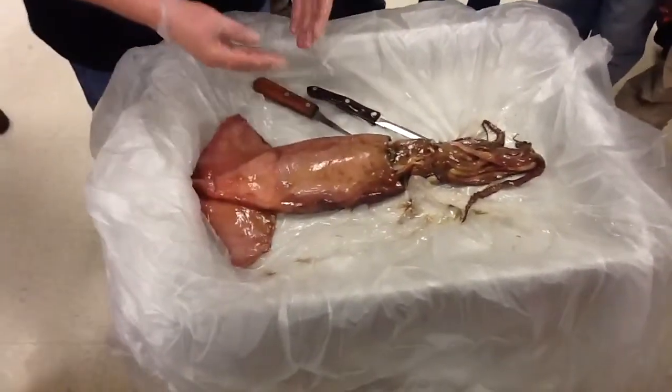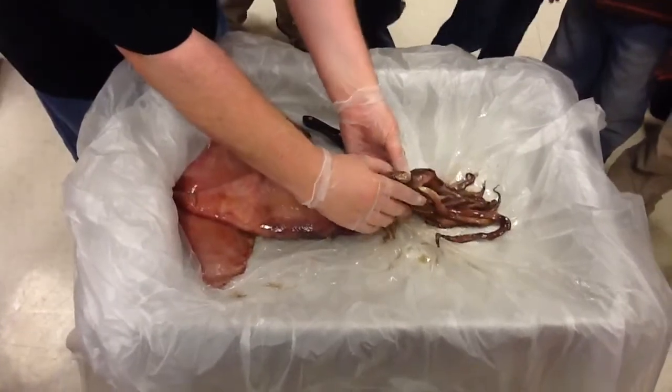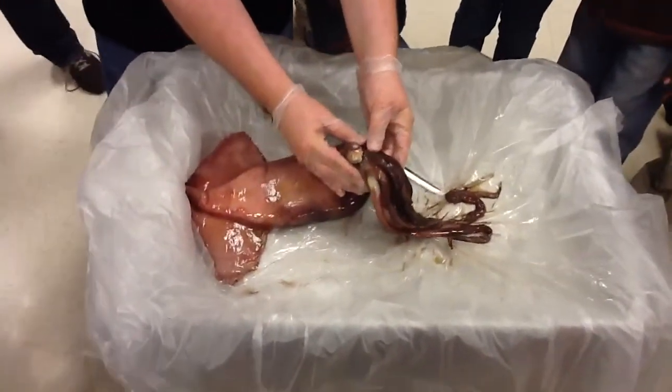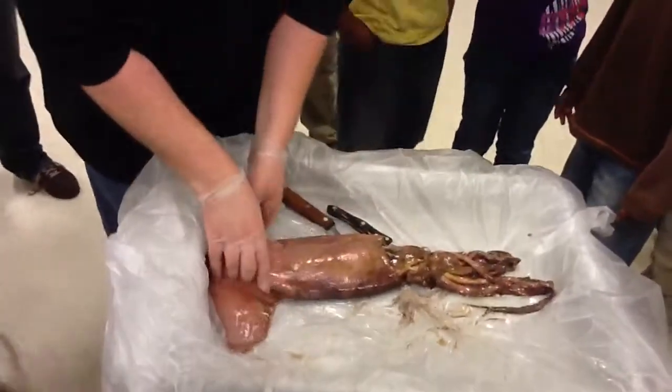Where's the eye? The eye looks like it's ready to fall out. So that's the eye right there. I'm not going to take it out because I think there's a certain way to take it out once we open it up. It's not a big eye. Hi, Squidward.